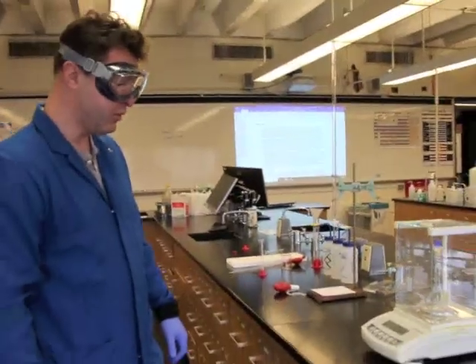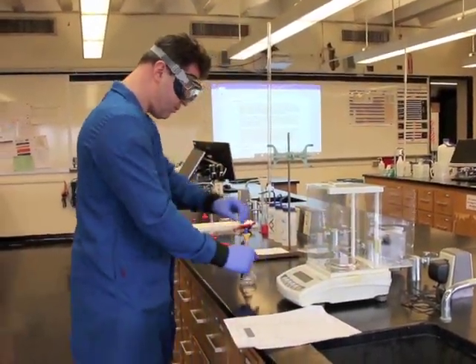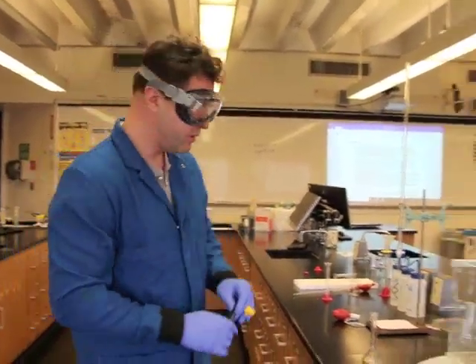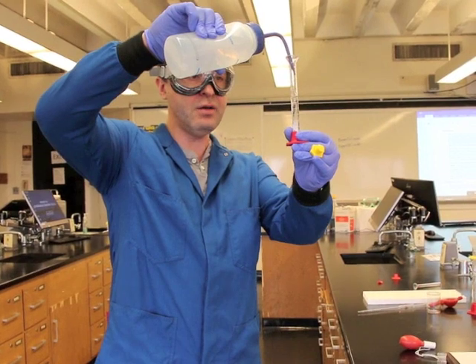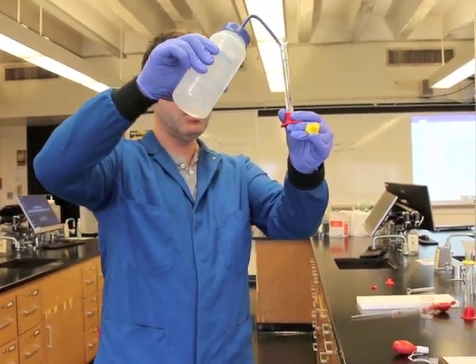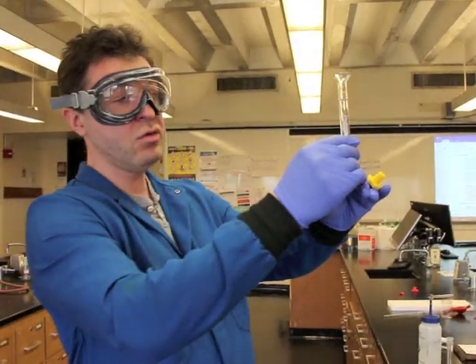There was a little drift in the balance but now it's all stable, documented as 55.5357 grams. Now the way you want to hold your stopper is between your fingers, because if you put it on the bench you're going to cross-contaminate it. The next step is we're going to fill the graduated cylinder up with water up to the 10 ml mark - always make sure the bottom of the meniscus is touching the line of 10 ml.